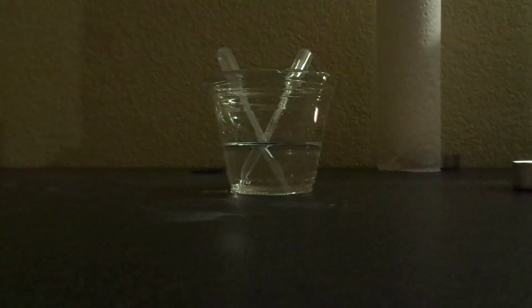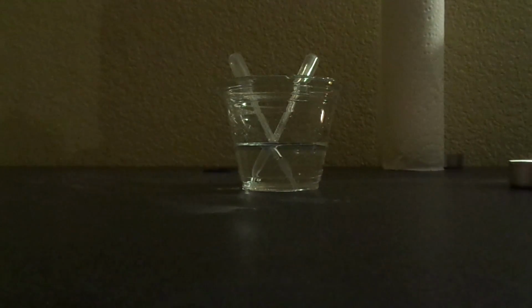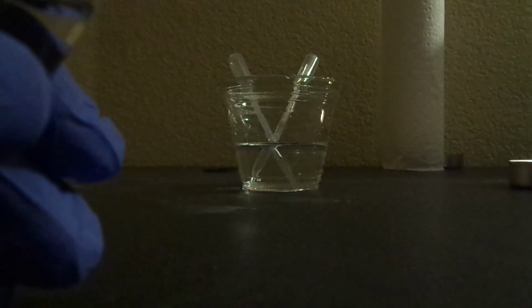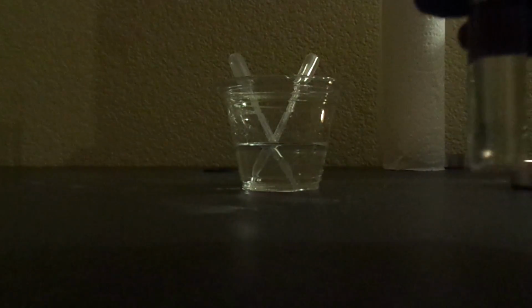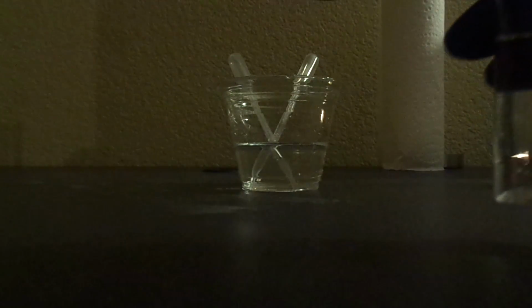Okay, so the first thing I'm going to do is adjust the pH of one of these broths. I'm going to take the one that needs to be a pH of 5. For that, I'm going to use the hydrochloric acid, just 1 drop of that. So I'm going to go ahead and adjust that.